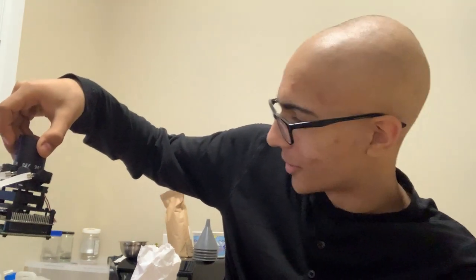What I've done thus far is to add 10 milliliters of my culture of Microcystis aeruginosa, which is one of the major cyanobacteria that causes algae blooms on the Great Lakes, into this vial here. You might recognize this vial because it's the vial from the Pioreactor, which I also have right here, a little out of frame because it's plugged into a cord all the way into the wall. What this thing can do is quite a lot of stuff, and I used to be using it for an experiment on algae growth a while ago.